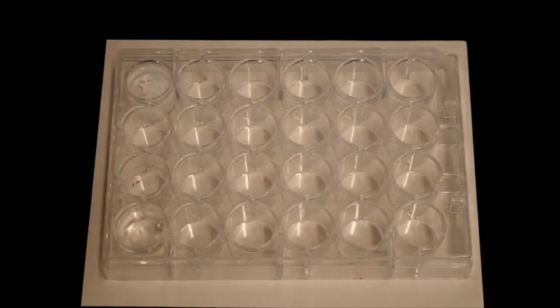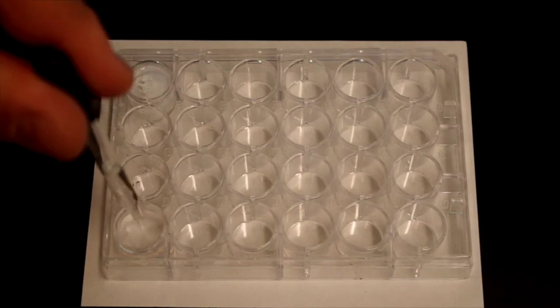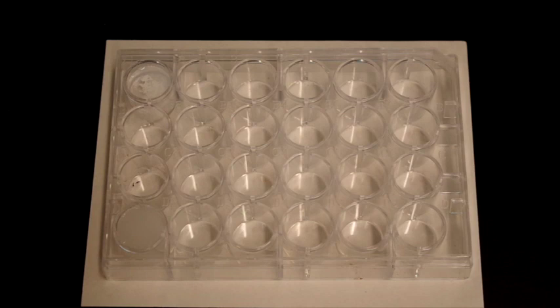And then we are going to add silver nitrate to the sodium sulfate and see what happens. Again, it may be a bit difficult to see what has occurred, but the solution has become a bit cloudy.